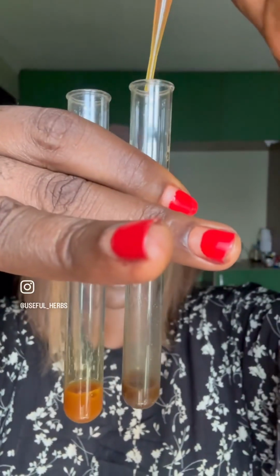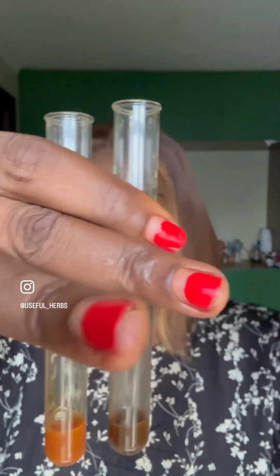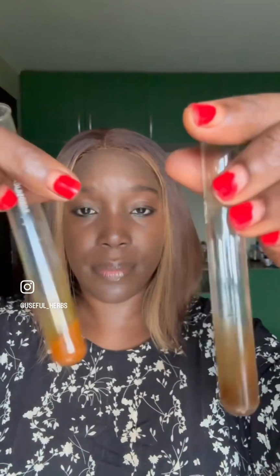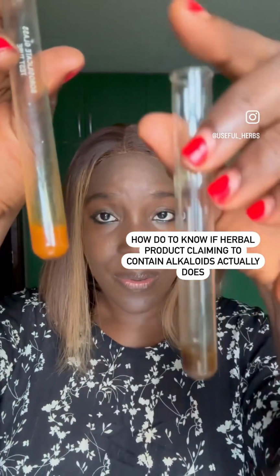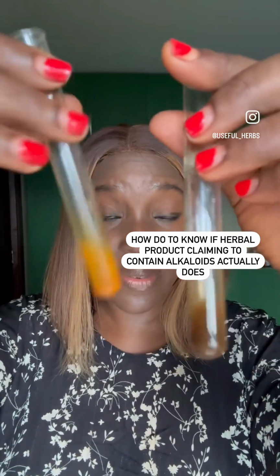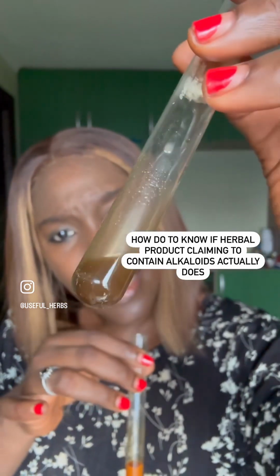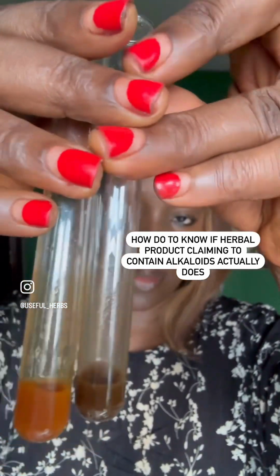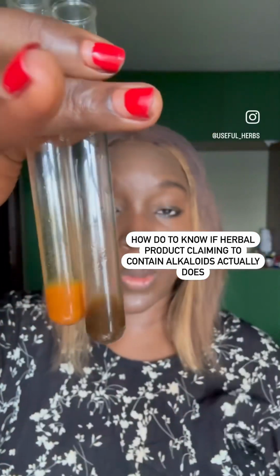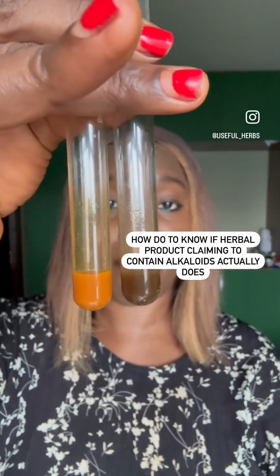So what do you observe? You can see the bright orange color. Okay, reddish. It either turns reddish or bright orange. And if you look here, you're going to see that this is also turning reddish. Yes. So we'll leave it for a while and then show you what it's like later.